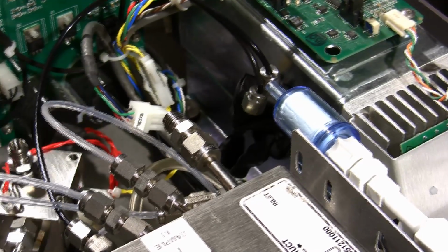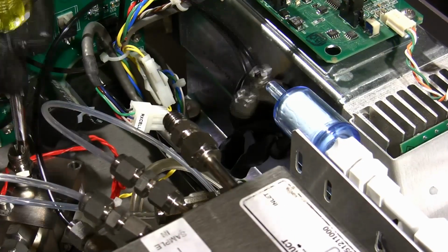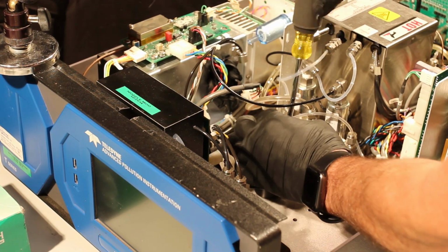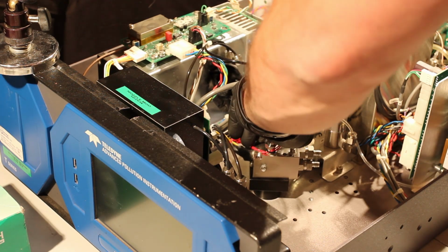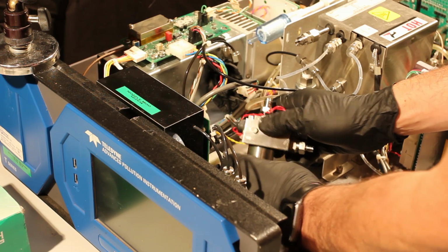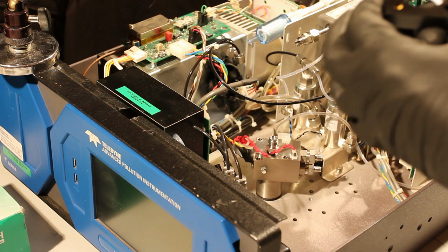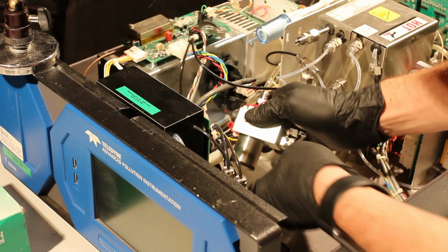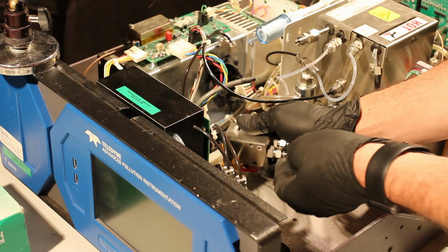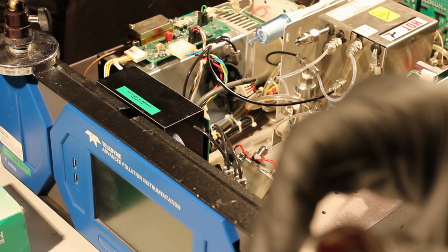I'm going to go ahead and set this down, and we'll pull apart the other two here that are holding the actual chamber itself together. So these will be our two shorter screws. Set those aside, and we can slide this piece out. There's a paper filter, or paper seal in there. We'll keep that in. We've got our infrared window here, which has been together for a little while. Not sure if we can see that on the camera or not, but it's definitely dirty in there.